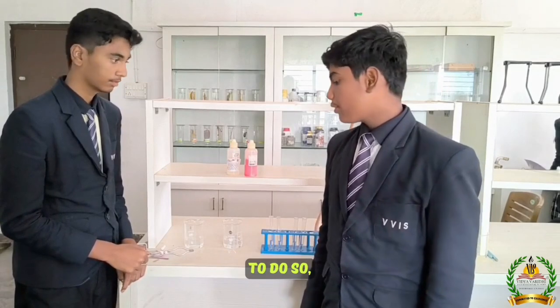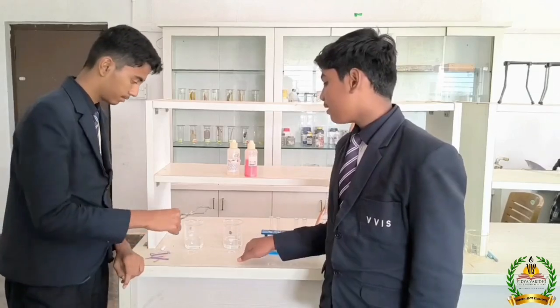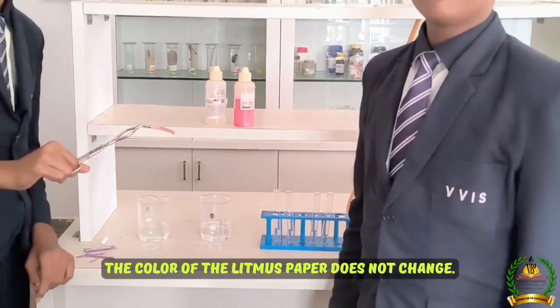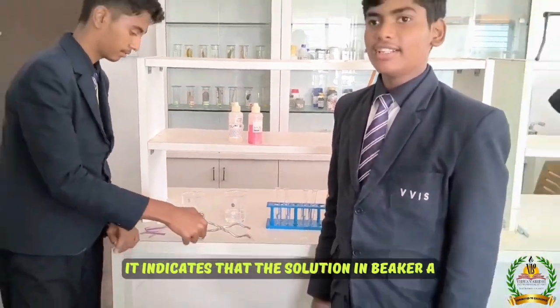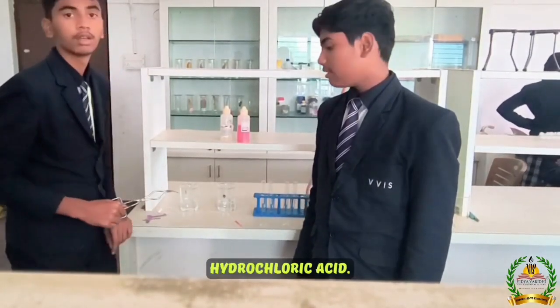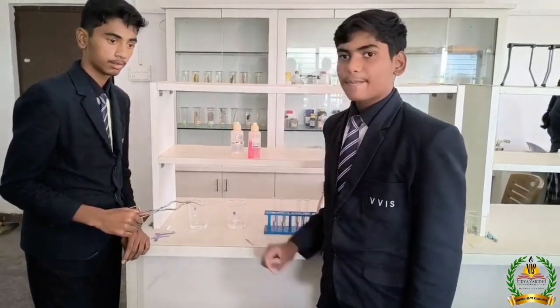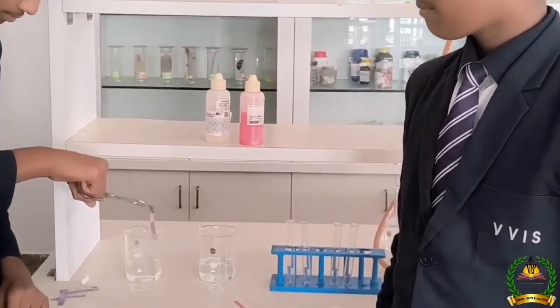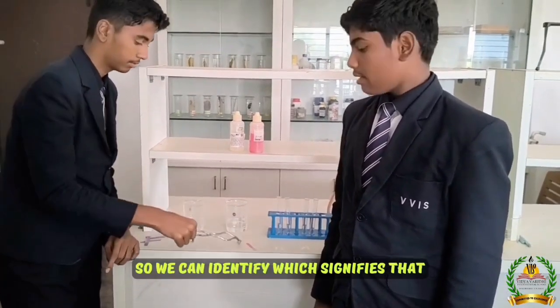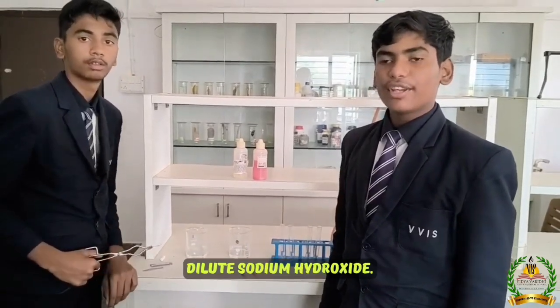To do so, first we will use red litmus paper and dip it in beaker A. The color of the litmus paper does not change. It indicates that the solution in beaker A is an acidic solution, that is hydrochloric acid. Now we will dip the red litmus paper in beaker B. The color is changed. So it signifies that the solution in beaker B is a base, that is dilute sodium hydroxide.